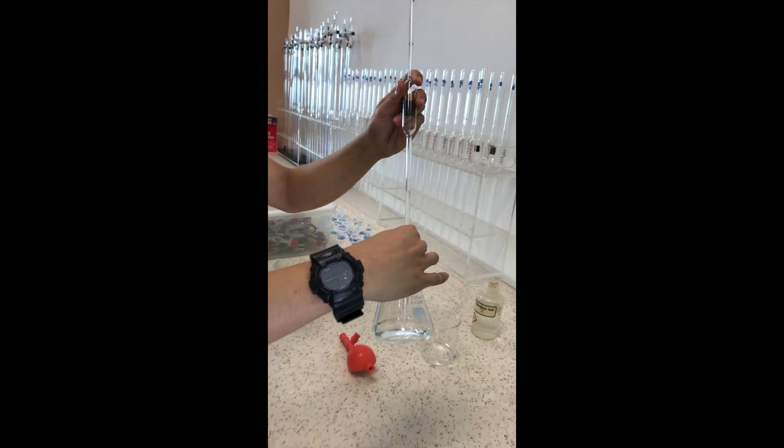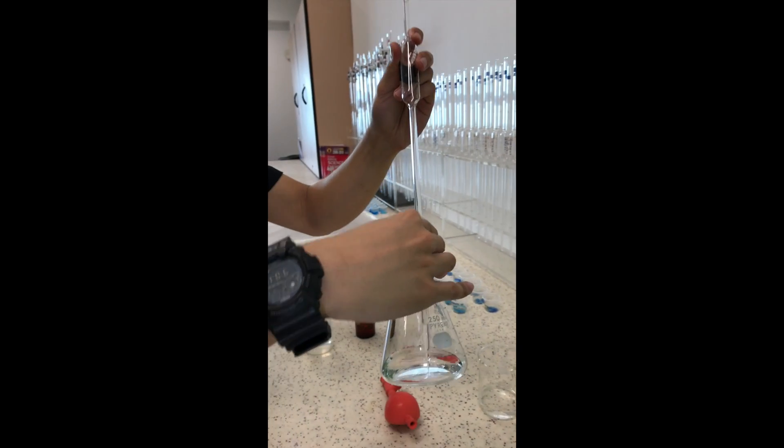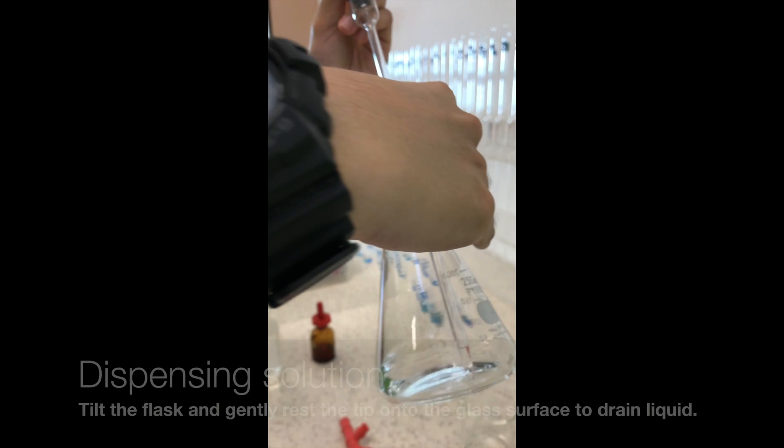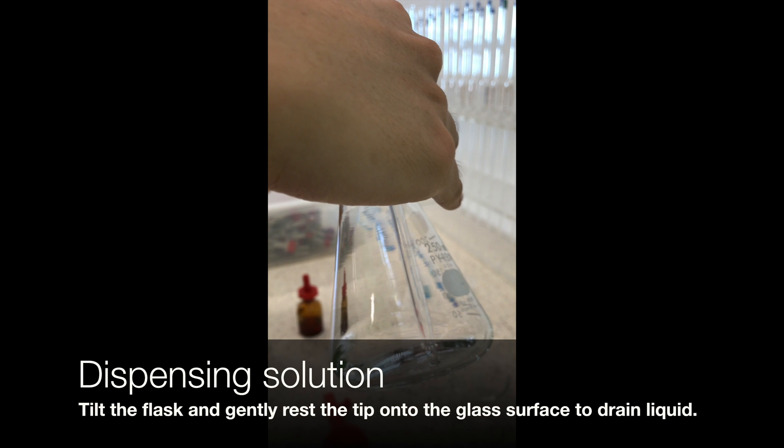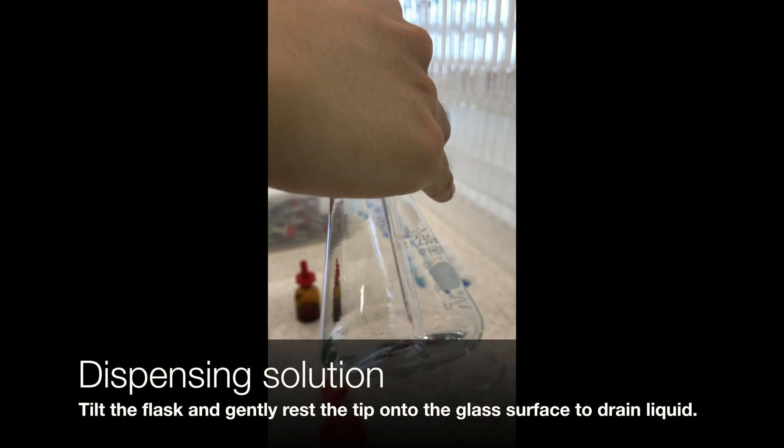We do not want to force out all the solution because pipettes are calibrated to allow for a small amount of solution remaining in the tip after the correct volume has been delivered.